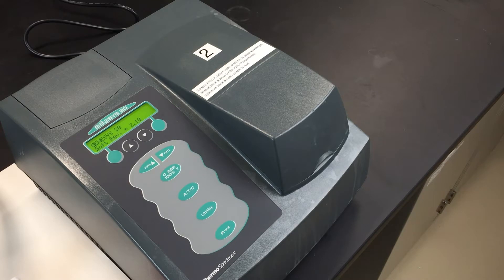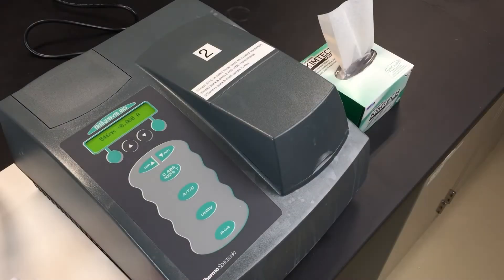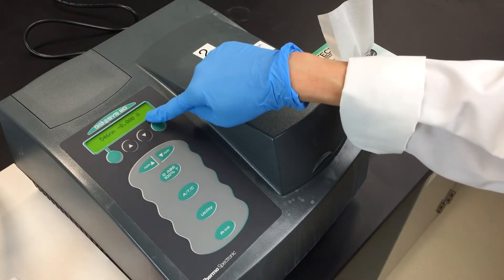If you don't let the spectrophotometer warm up properly, you'll get an error message when you try to use it. This is what the screen looks like when it's warmed up.